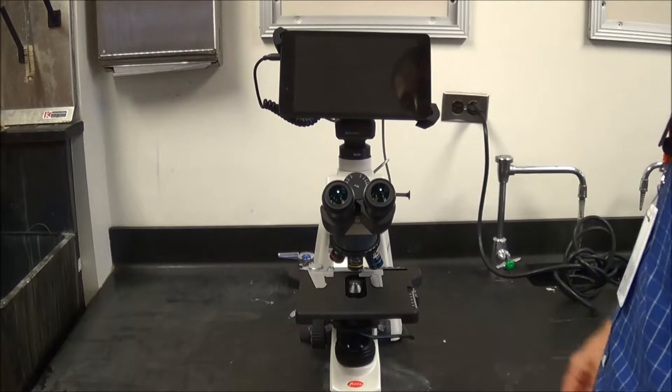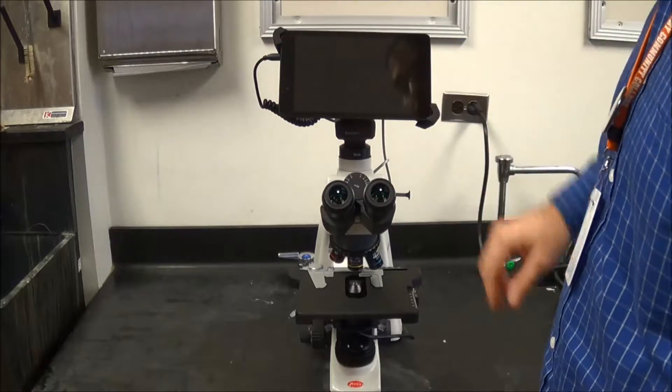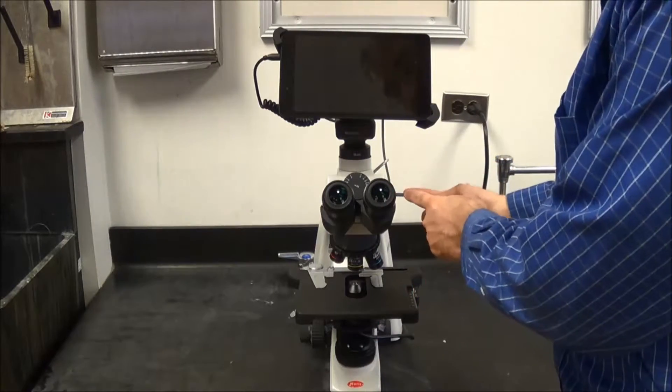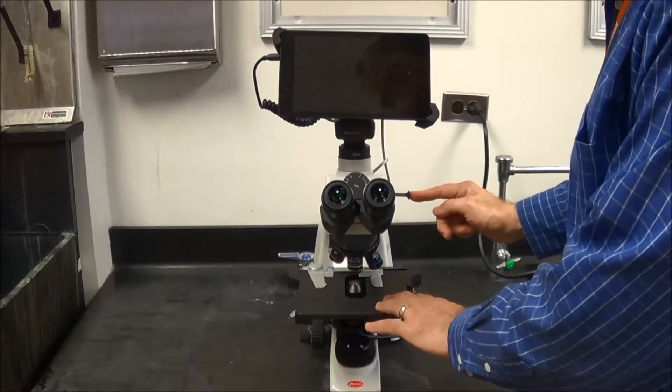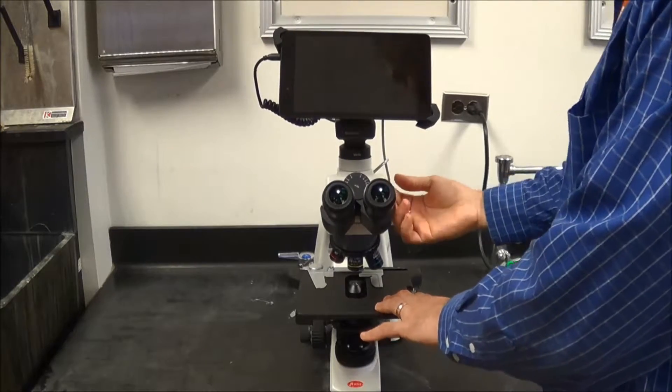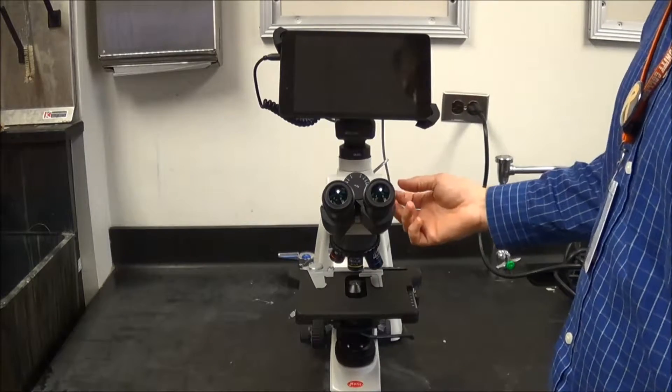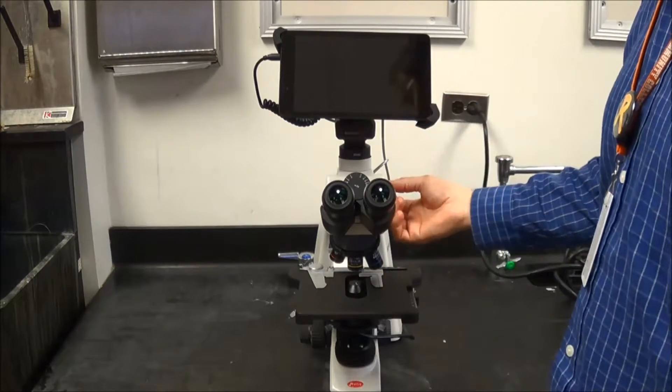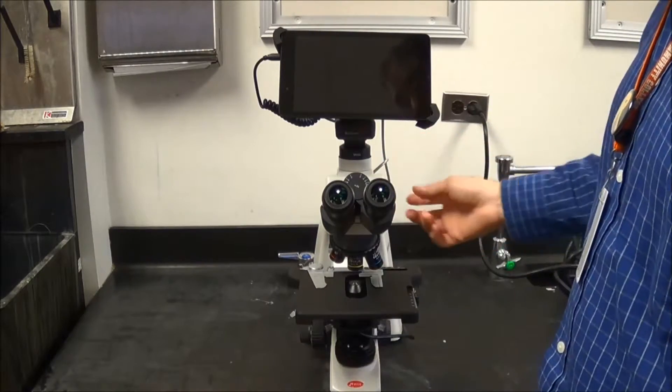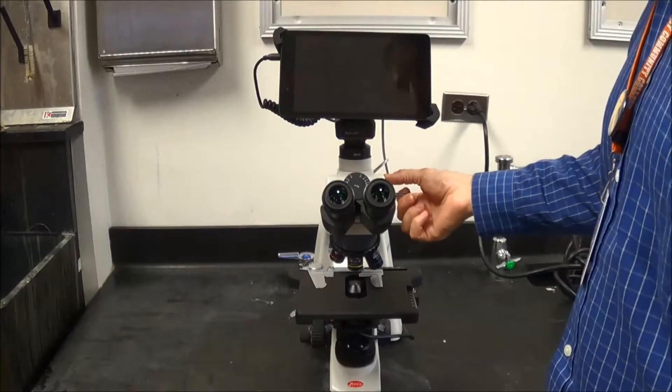A couple of other things. In addition to turning the tablet off and unplugging, please make sure that they do not press this button in right here. Remember, when it goes in, it cuts off the light going to the microscope. So the next person to use this microscope will not see any images. Make sure that they leave this in the out position.